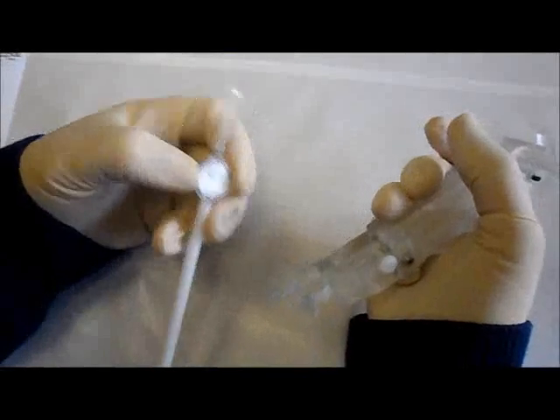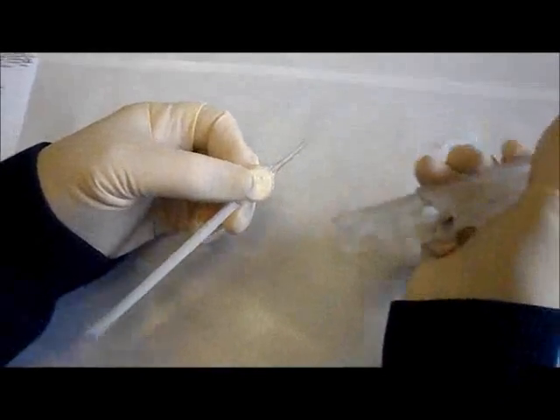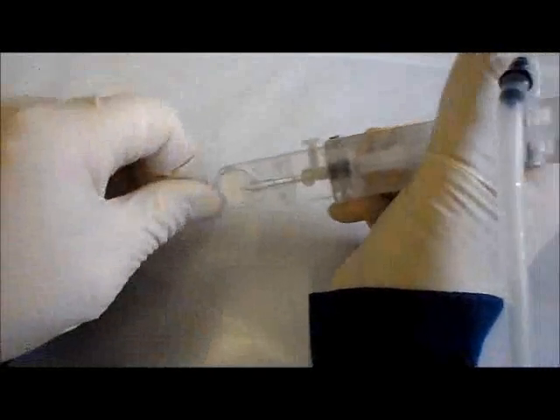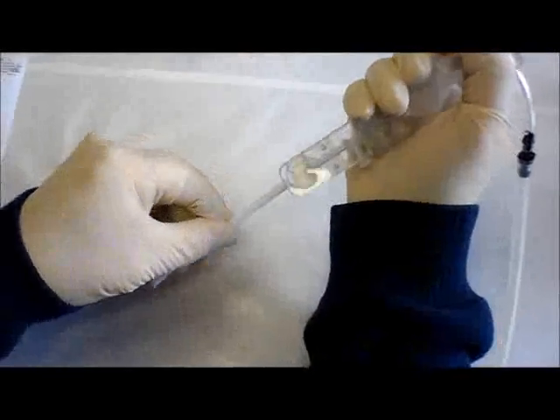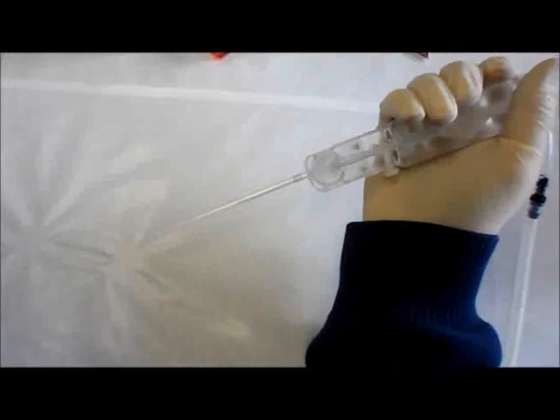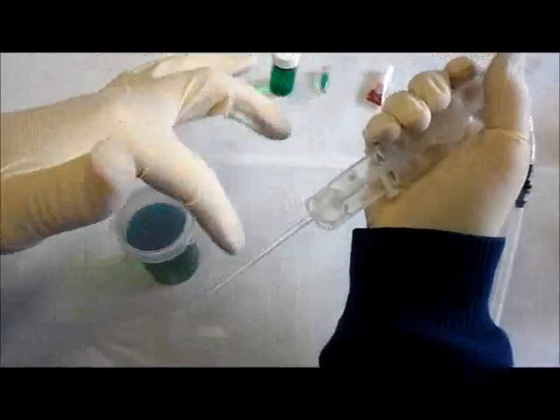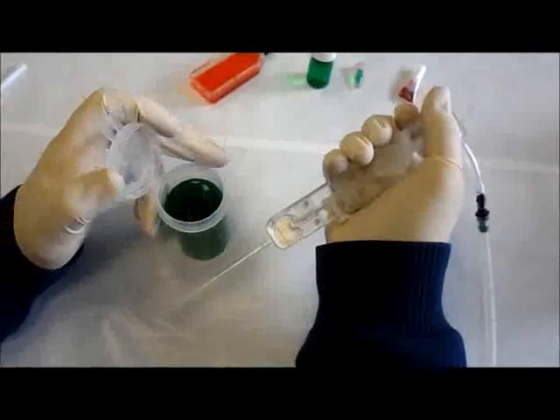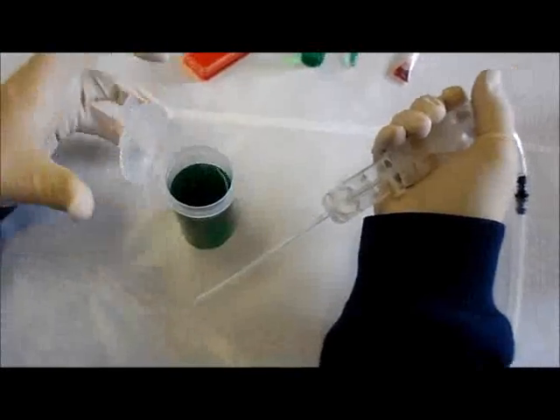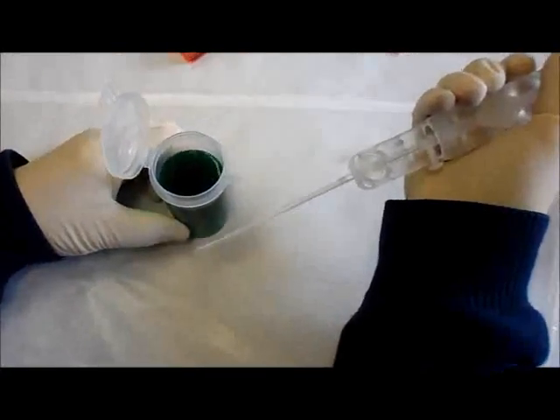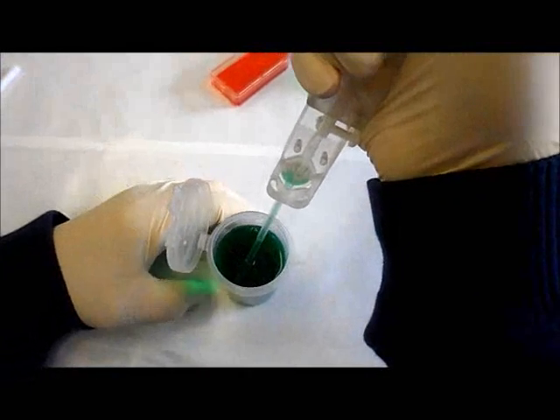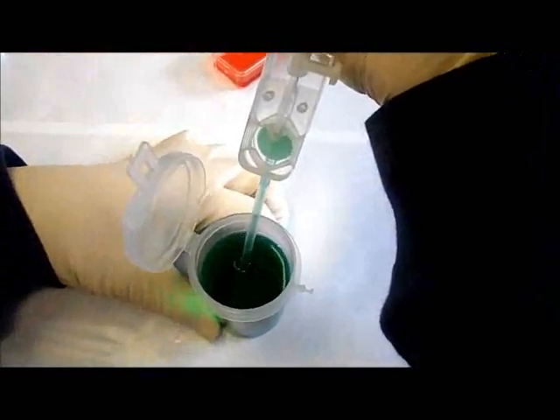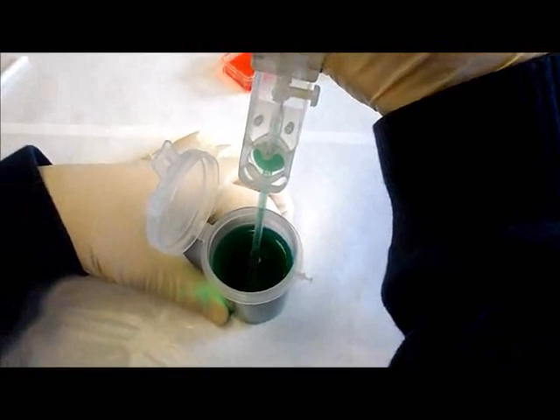The way that the system works, in this case we've got it set up for doing a microbial sample preparation. The guard comes off of the end here and this goes into our suction tool. The filter snaps into place, and then I'm going to take off this protective guard exposing my extension tube here as an inlet which I'm going to put into, in this case we've got a 100cc vial of colored water that's serving to simulate a water sample test and it would have bacteria in it. It draws the fluid up and you can see that the green liquid is now entered into the filter cartridge and I'm going to allow the filtering to go on.